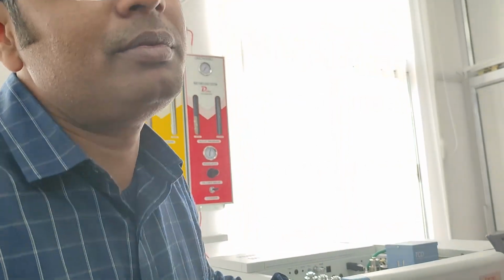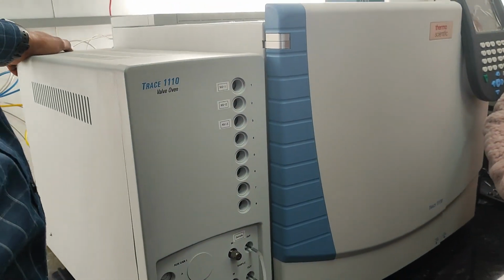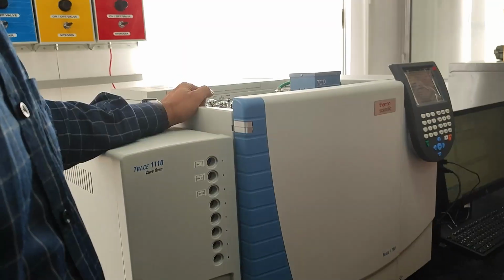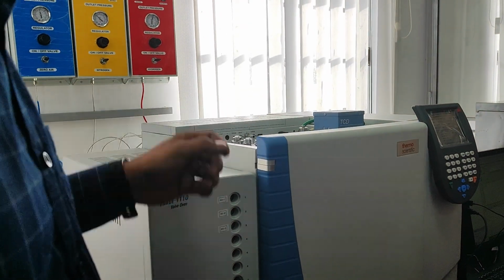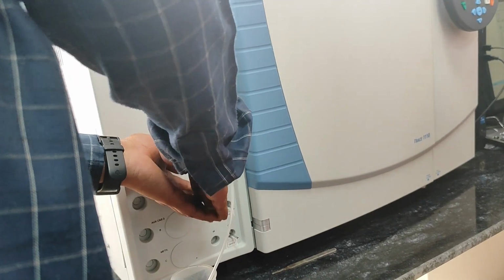You want to see the valve? That valve. So there is a 4 pack column inside it. I will show you. If you want to inject with a syringe, bladder or any separate container, you can make an adapter and use that inlet directly.